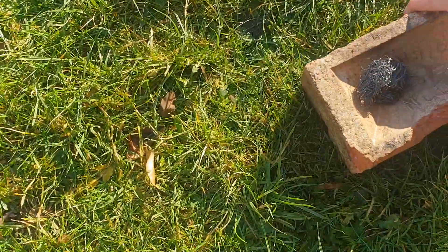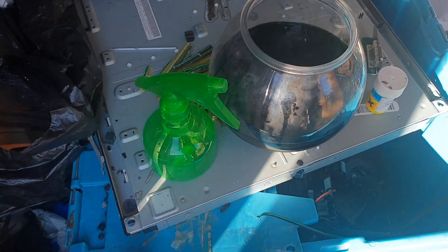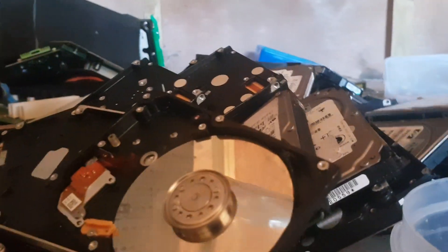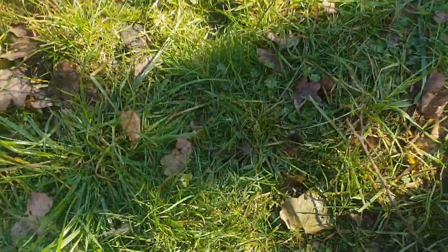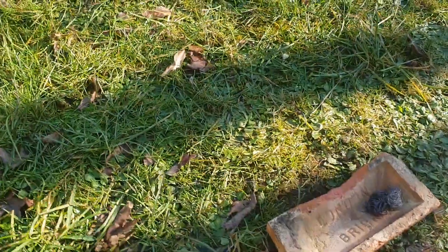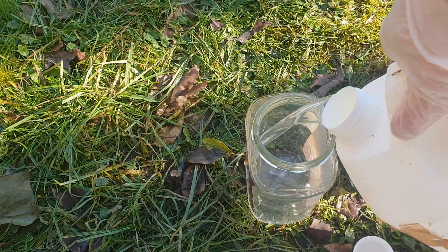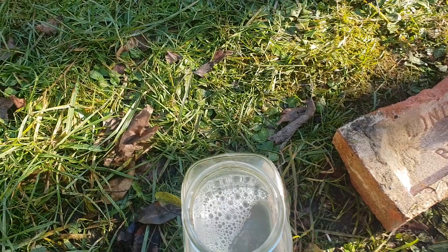I don't even have the torch on its highest setting. We'll take it over to the hydrochloric acid — I'm using a coffee container. I'm back, I've got some gloves on. That's all we're going to do. We'll just pour it in — looks like about enough.